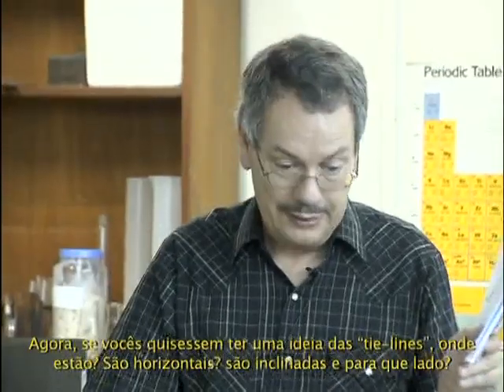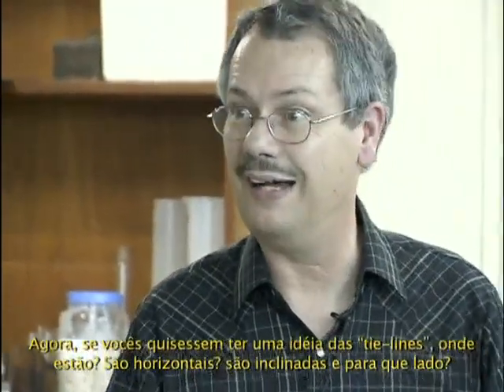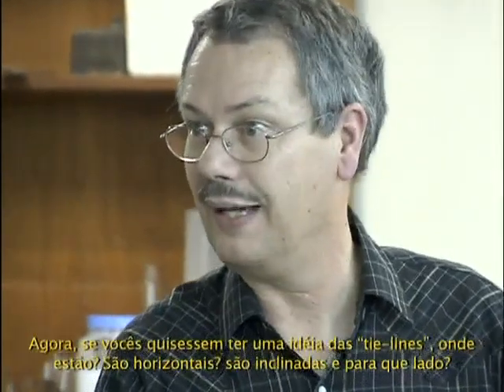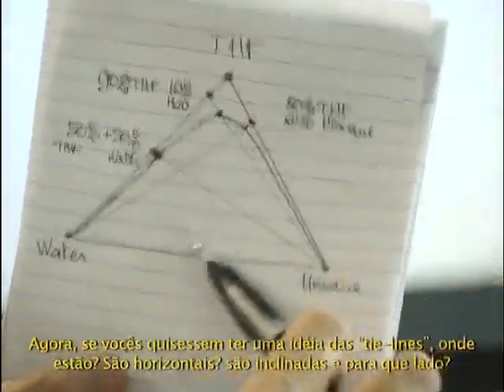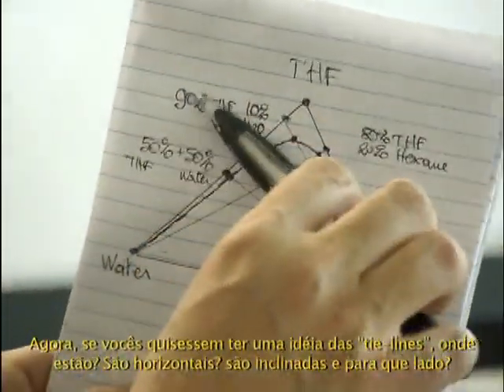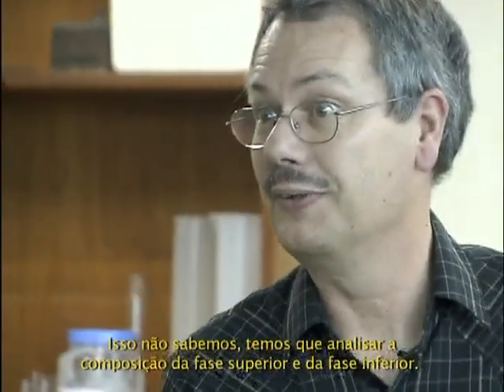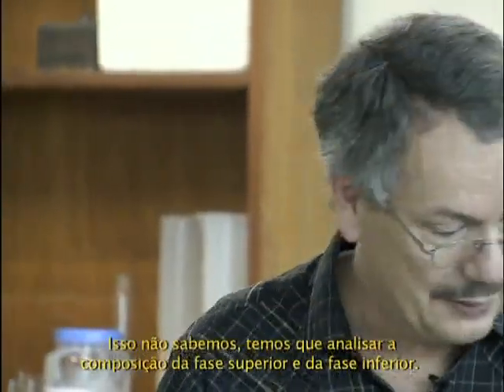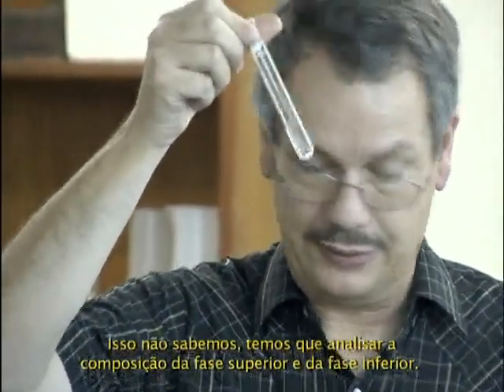now, if you would like to have an idea of the tie lines, where are the tie lines? Are they horizontal? Are they sideways? Which way? This way? This way? You don't know. You have to analyze the composition of the top phase and bottom phase.